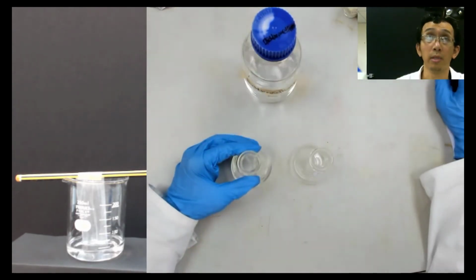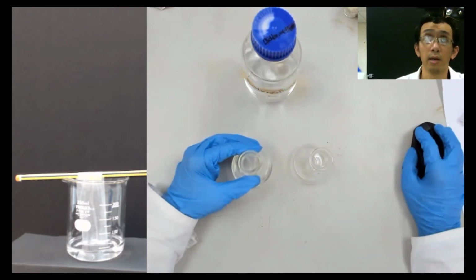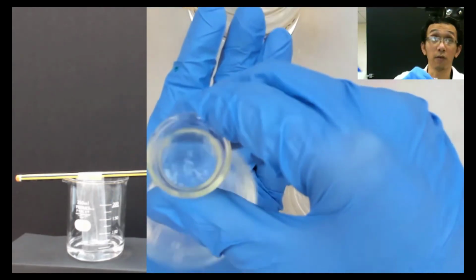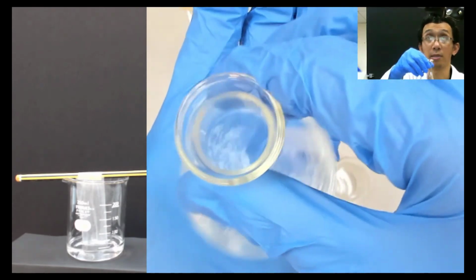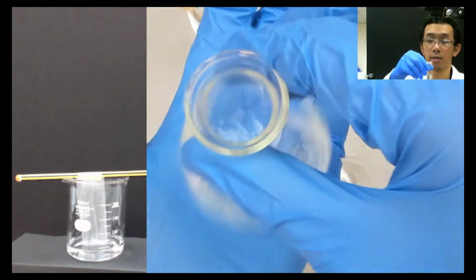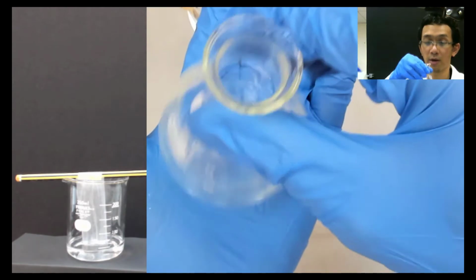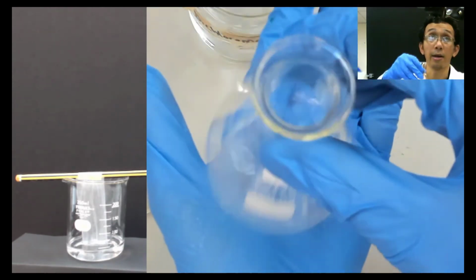So let me zoom a little bit here. If you see here, it's already dissolved. I mean there is nothing inside that. If you use water, it will not do like this. You still see a clump of powder. Because you're using an organic, non-polar solvent, it will dissolve like that. So that's one X, and that is Y.